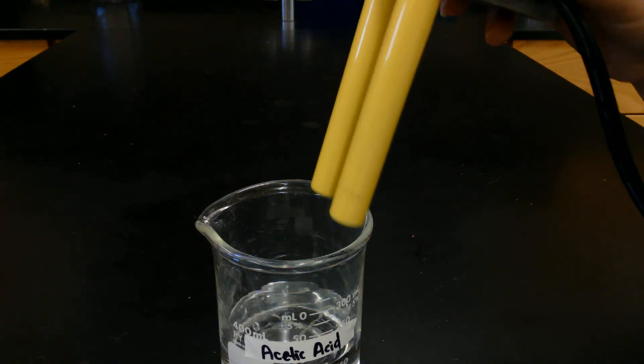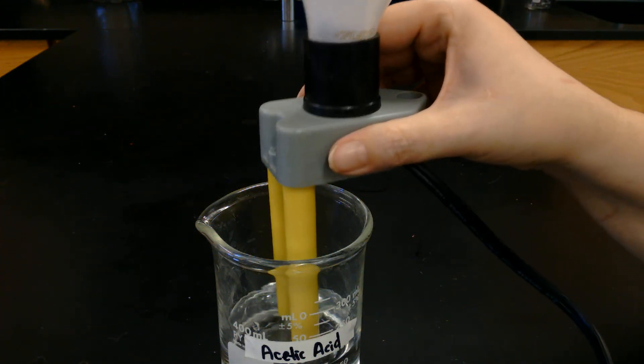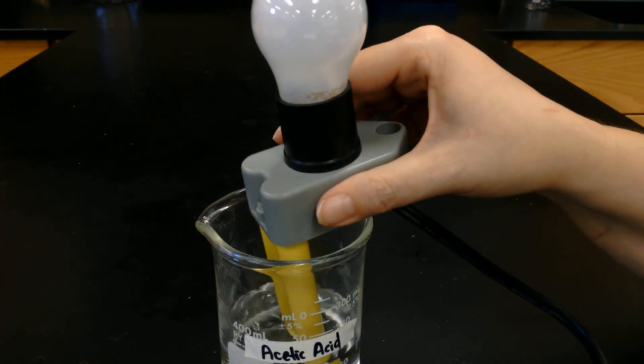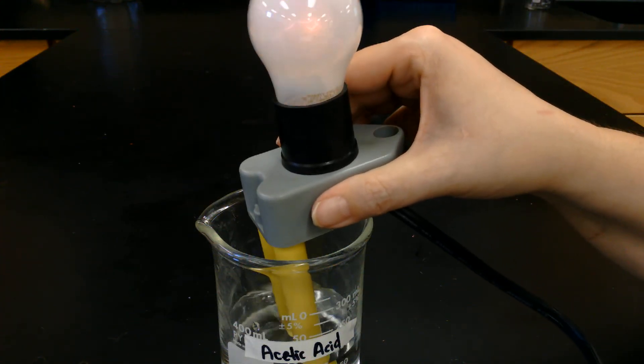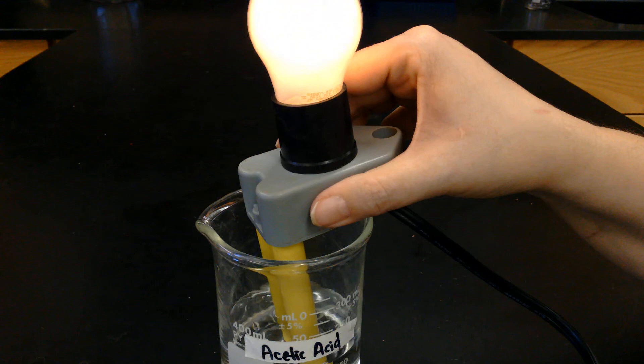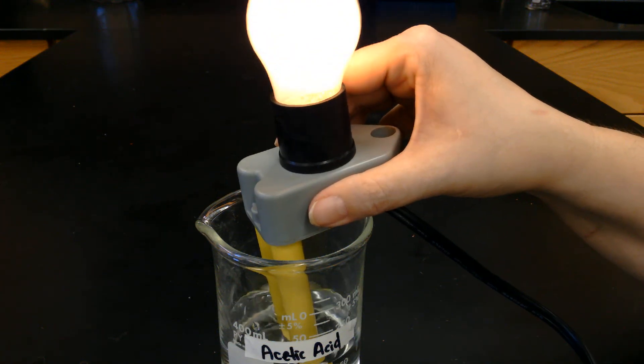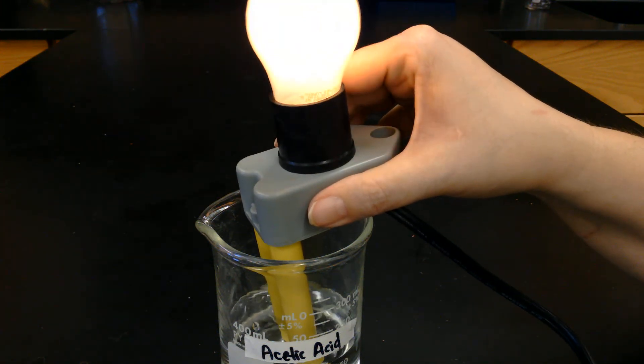We're going to try some dilute acetic acid solution. It shows a little bit of light. Go ahead and make your observations on that one.